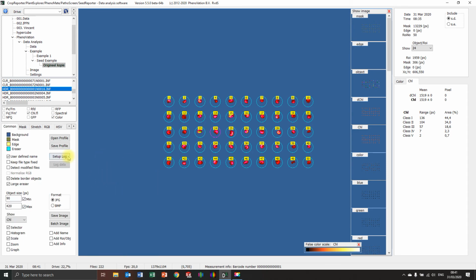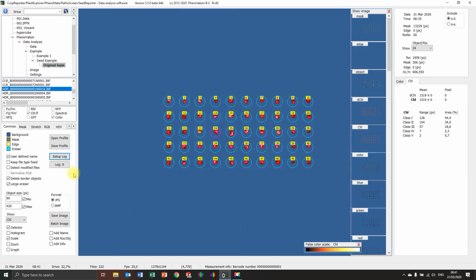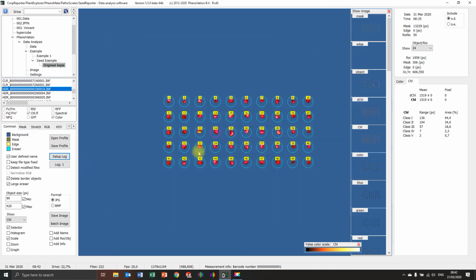So what we can do is a setup log. In this case, I want to measure the chlorophyll fluorescence, so CHL. Maybe I also want to measure the red, green, blue value. Maybe I can see something about that. And I want to mask, or I want to see those classes, the classes we just set. If you don't want to use a batch analysis, you just do it like this. You press OK, and you say log. Now this file is logged. And you see we set total image and object regions. So this one is logged.